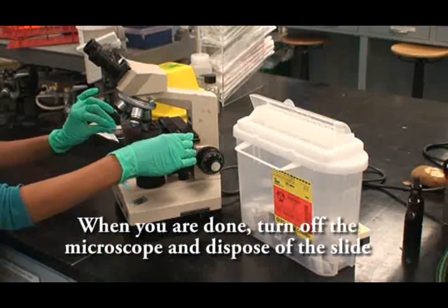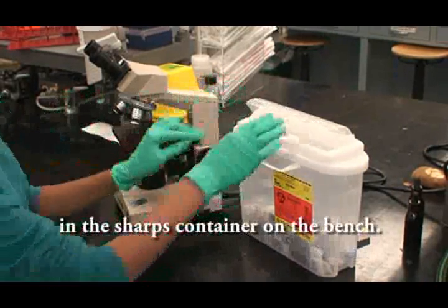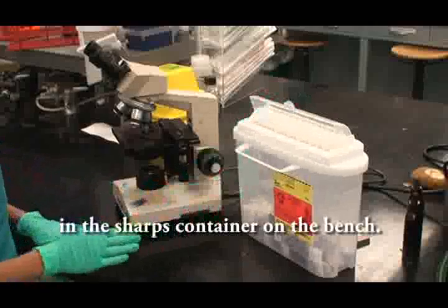When you are done, turn off the microscope and dispose of the slide in the sharps container located on the bench.